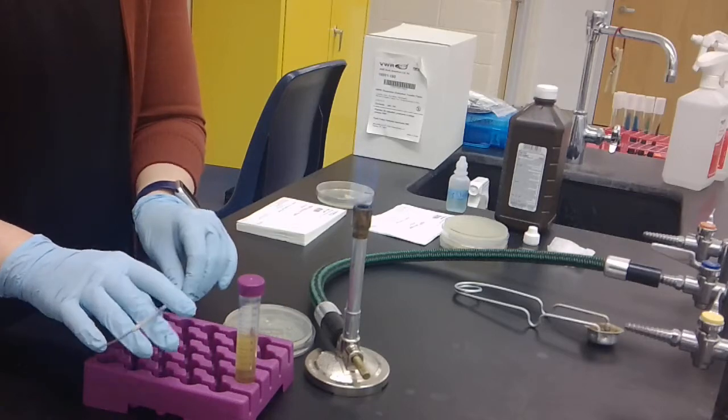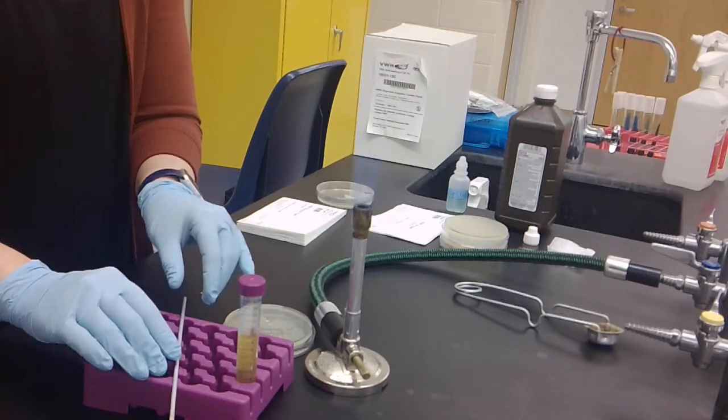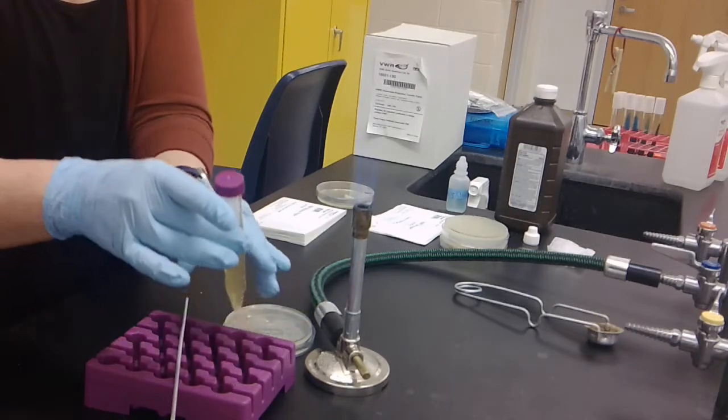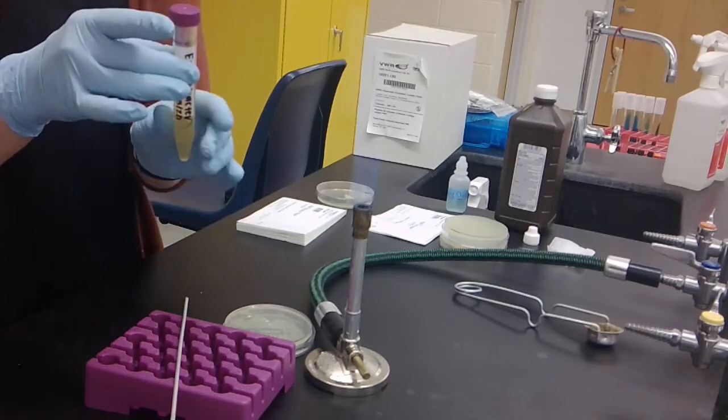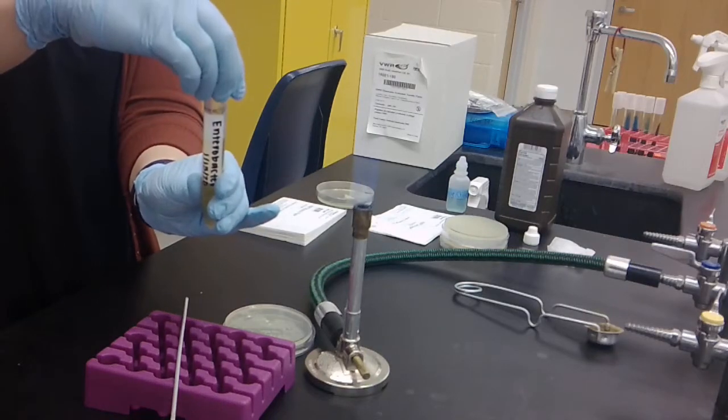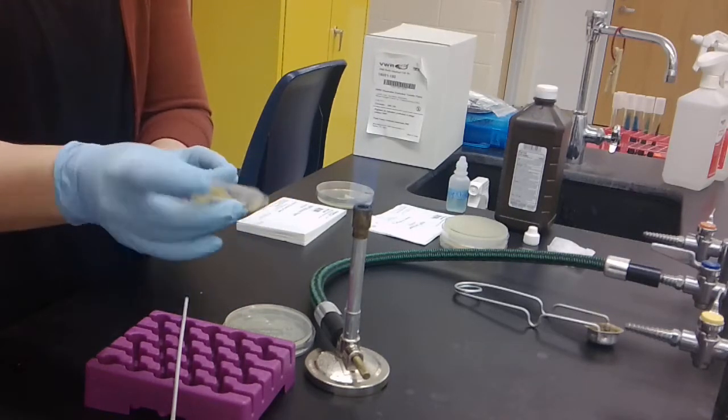When working with broth cultures, you have to be very careful to clean the broth culture using the flame. To do this, you will first take your broth culture and tighten the lid, and then invert the culture several times.